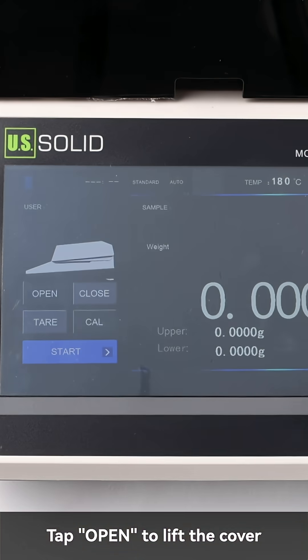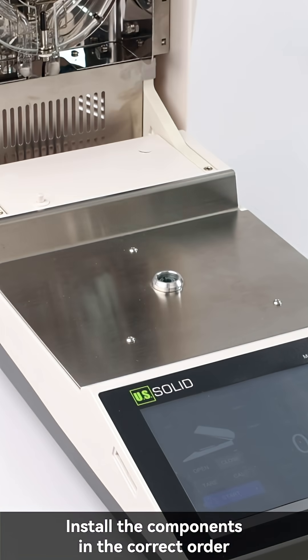Tap open to lift the cover. Install the components in the correct order.